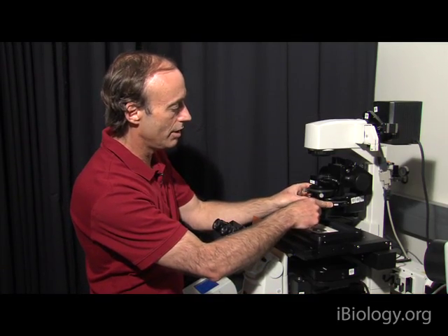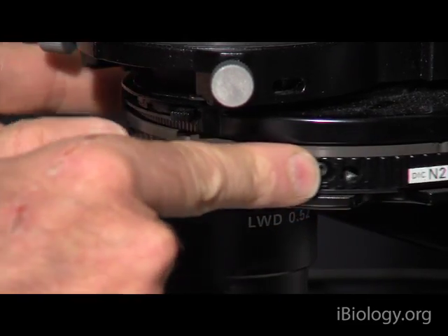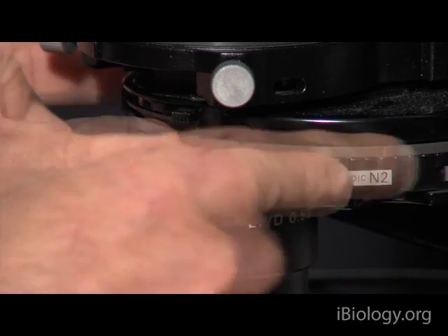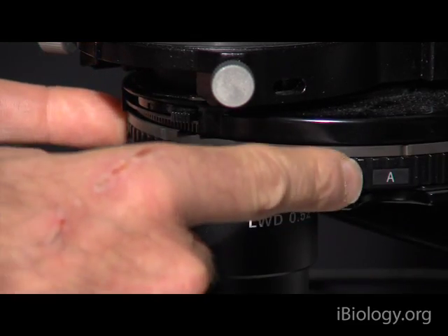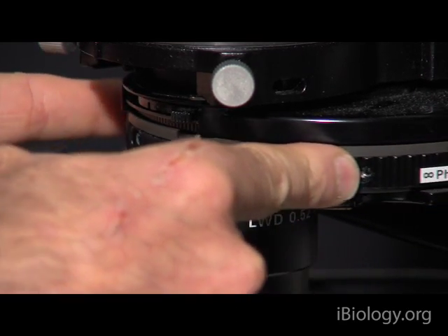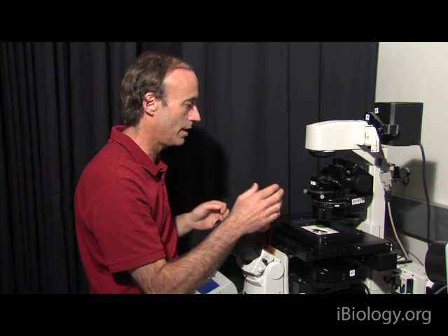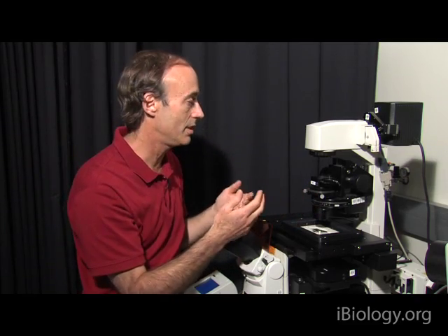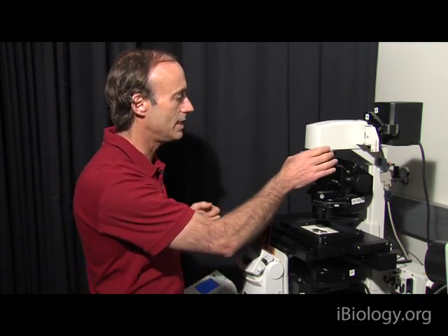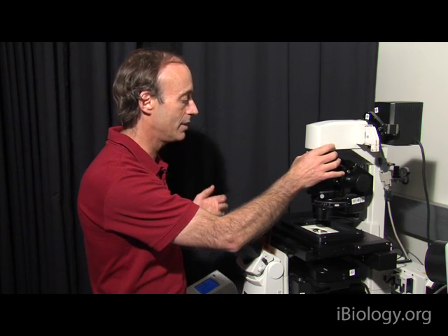This condenser turret also has different settings — some of them are for phase microscopy or DIC — and I'm going to make sure it's in the right setting for bright field microscopy. So now everything is set up. The first step in Köhler illumination is to focus on the specimen. To do that, I'm just going to make sure I have enough light going through the system, so I'll open up the field diaphragm.